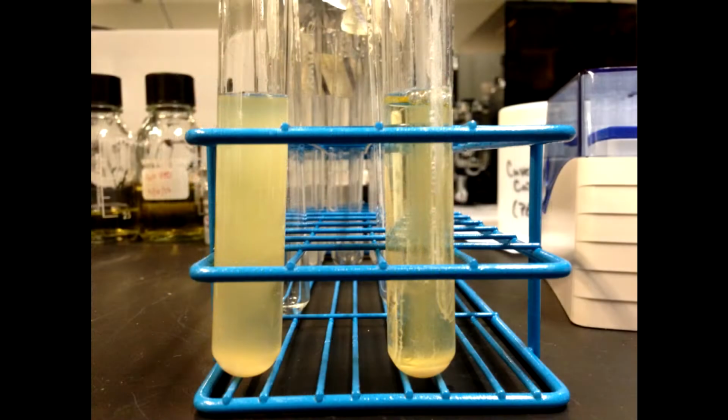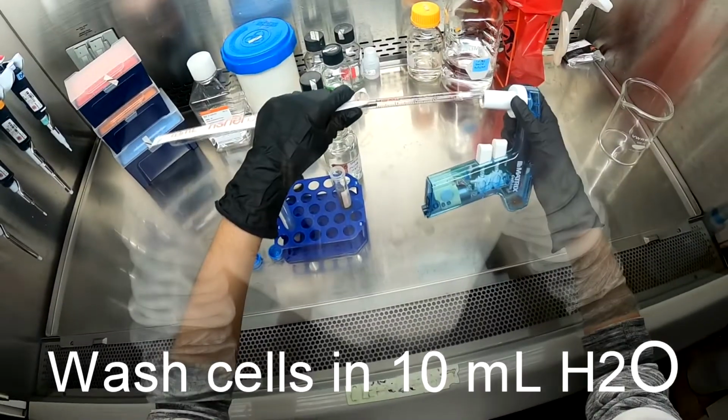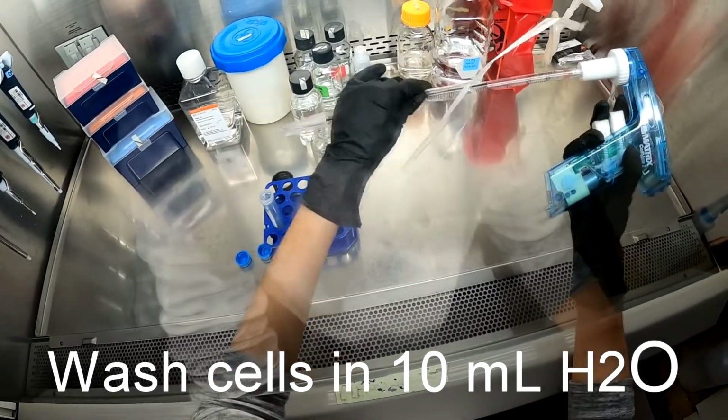To begin this experiment, the yeast first had to be cultured in liquid YPD medium for 2 days at 30 degrees Celsius. The yeast was then pelleted and washed with 10 milliliters of sterile water.